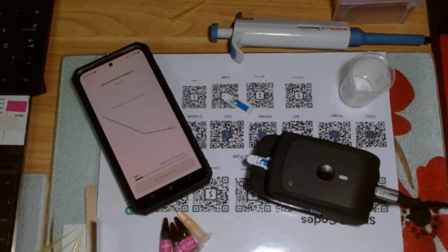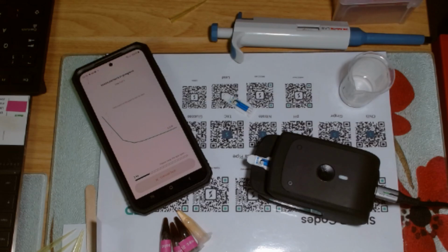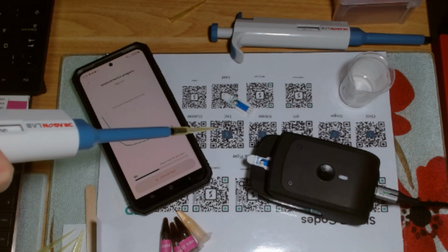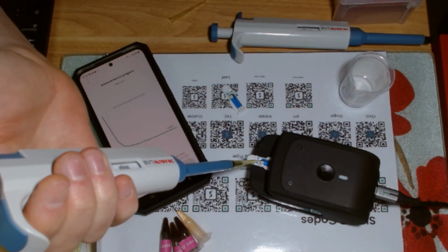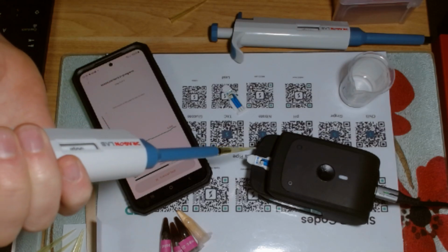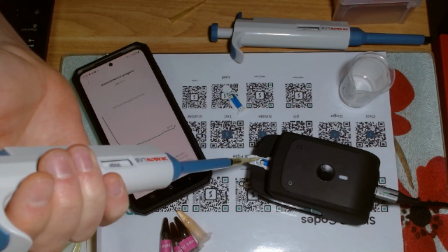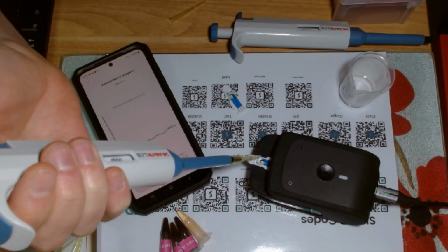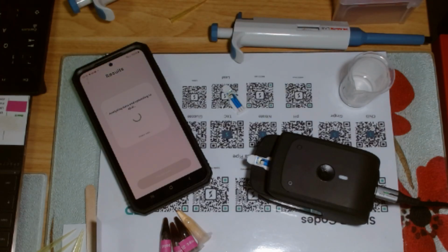Now I'm going to put in a fake sample of nitric oxide, because I'm just simulating the experiment, as nitric oxide is actually toxic and I wouldn't handle it, even at low concentrations, in this situation. So let me put in a drop here, and then the sensor will, let me put in a bit more. And you can see that every time I put a little drop in, the signal will increase, and then the experiment came to an end.